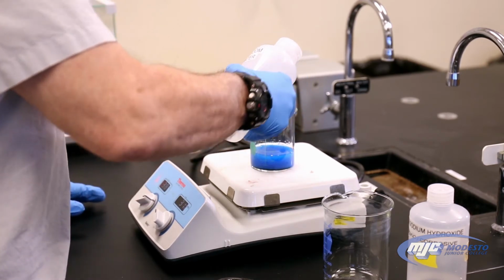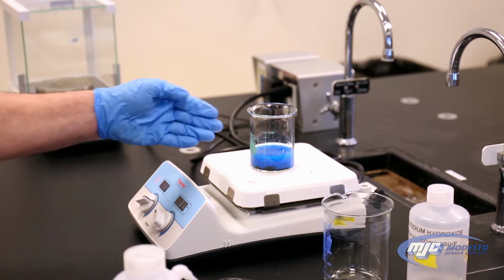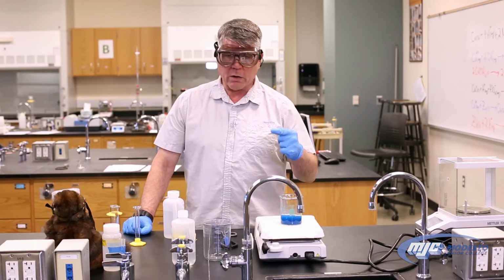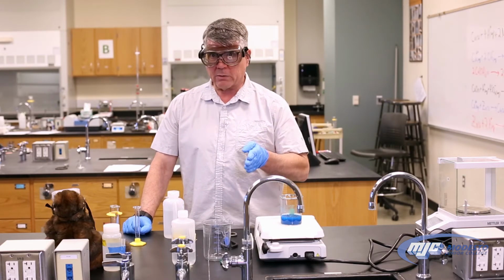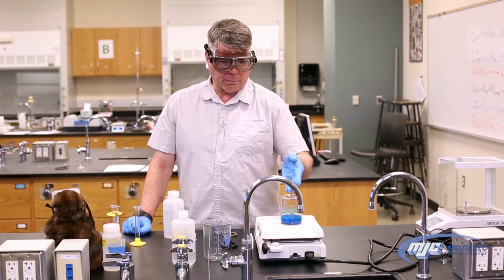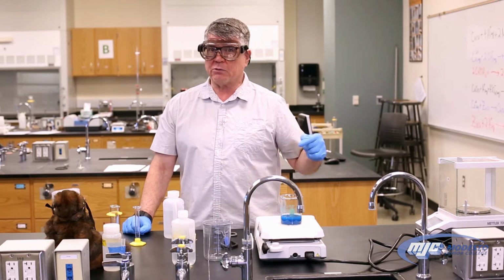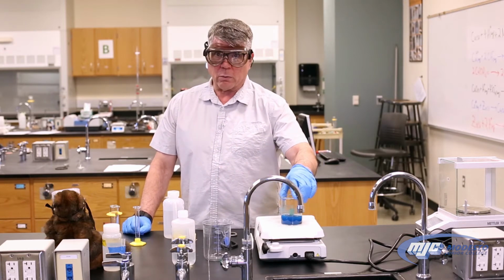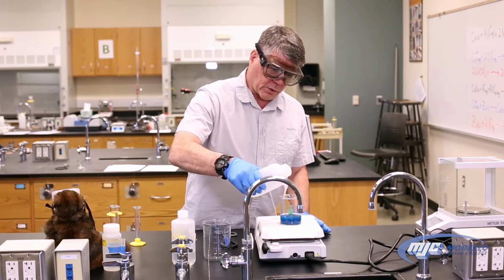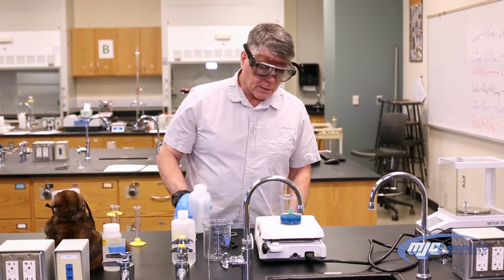One of the things that you learn in this experiment is transferring. See that bumping right there? Got to be careful about that. Whenever you transfer something from one container to the other, and we do that a lot in this experiment, you lose some of the material that you're transferring. Our goal in this experiment is to transfer every single atom of copper that we started with until we get to the very end. All we can do is the best that we can, and some of the tricks are to make sure that when you transfer something, you rinse it well so that as much as you can gets transferred over.